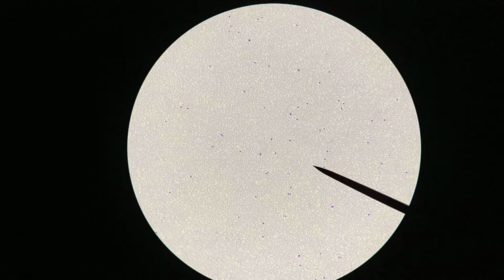As you can see, even at this magnification, there's lots of red blood cells here. These are the main component of blood, or at least the formed elements of blood. And so the leukocytes, the white blood cells, are a very, very minor component here. About 2% of all of the formed elements of blood are going to be leukocytes and platelets. Okay, so what we're going to do is try to find a few good examples of the different leukocytes that we've talked about in class.